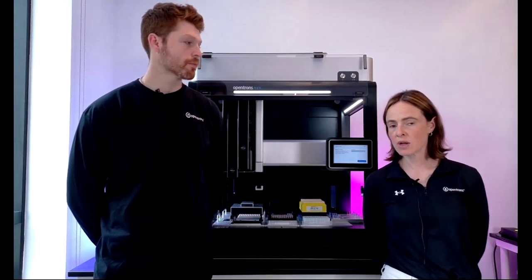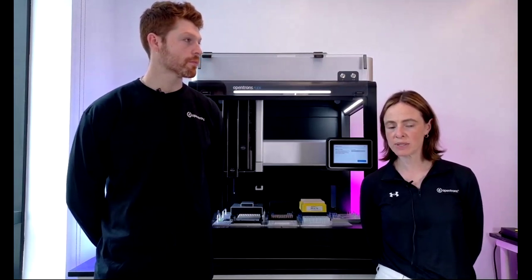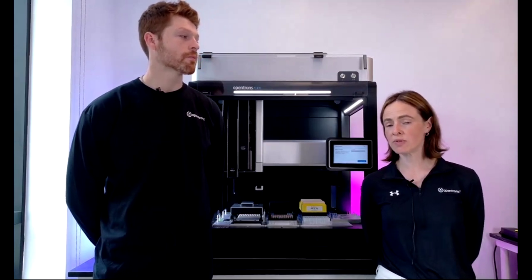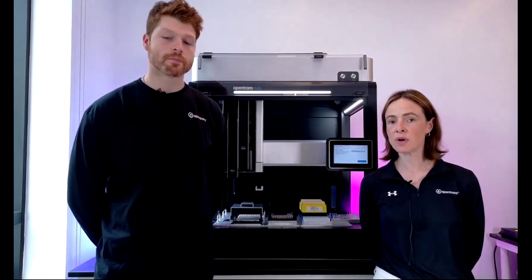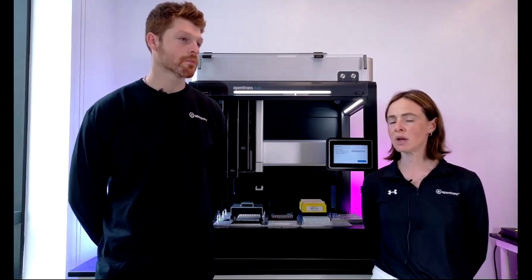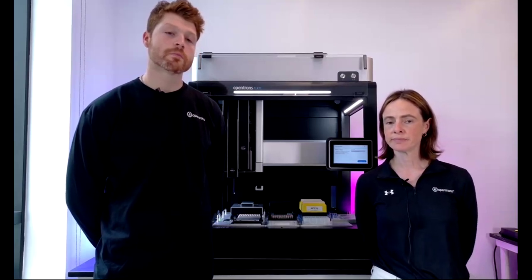But also, I think I caught at the end of the question that they're currently running separate pieces of equipment with an OT-2. So if you can do it with an OT-2, you can do it with a Flex. Yep. And it would be very similar because the code base is the same. It'd be a very seamless transition to integrate the Flex if you already have the OT-2 running. Yep, great point. Thank you, guys.